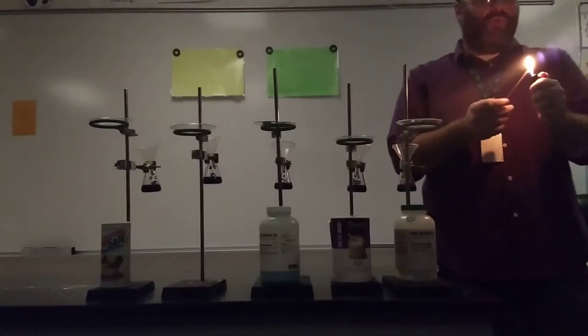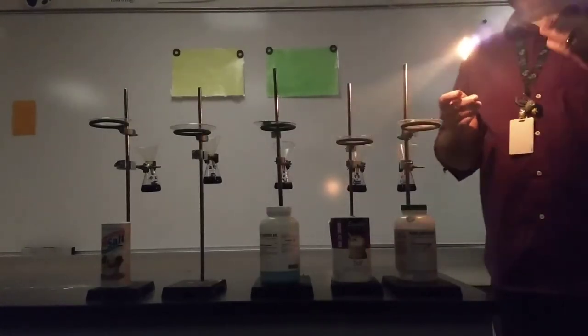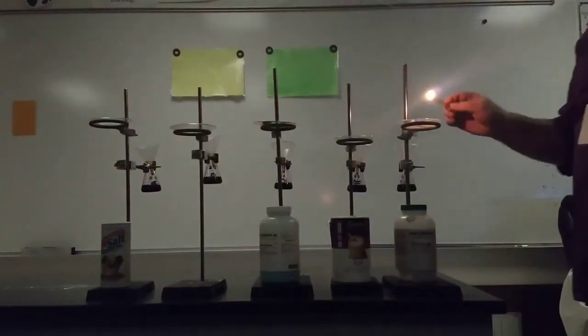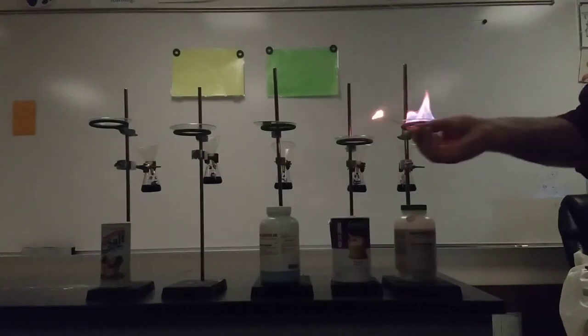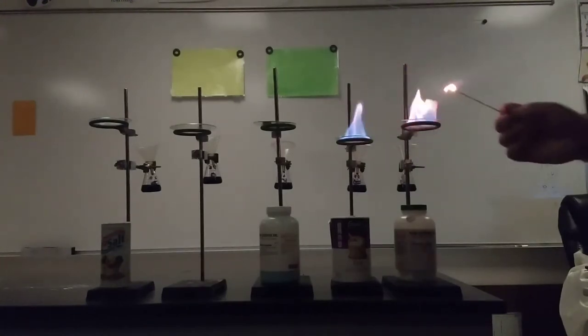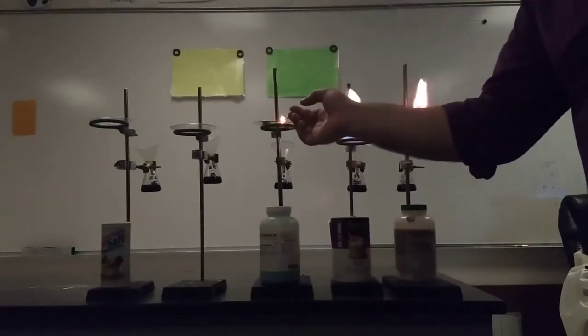Depending on the Bohr model, electrons jump to different energy levels, and so each substance has its own unique signature of light that it emits. Sometimes it emits red colored light, or orange. Sometimes it might take a little bit for the salt to get excited. Green.